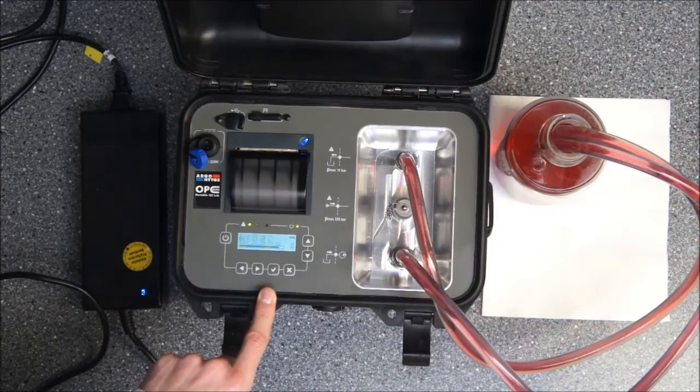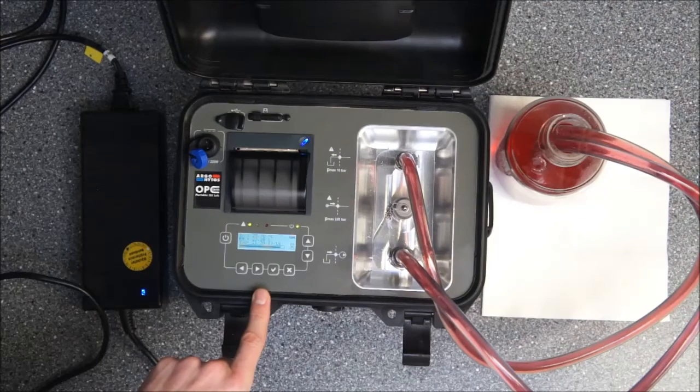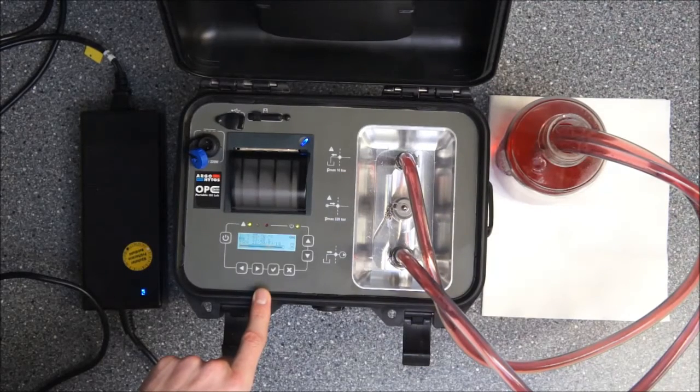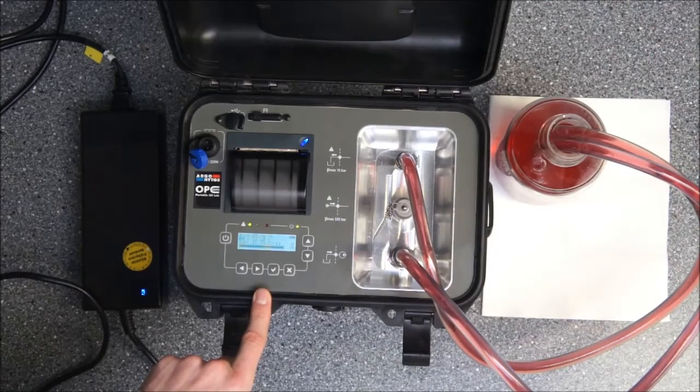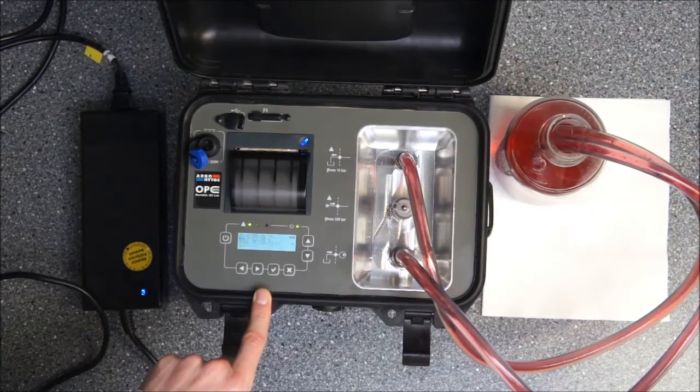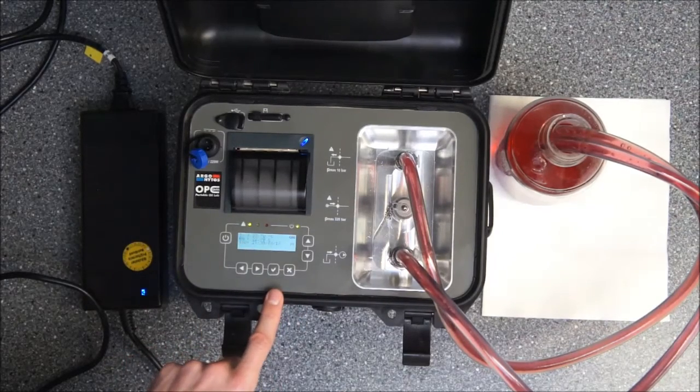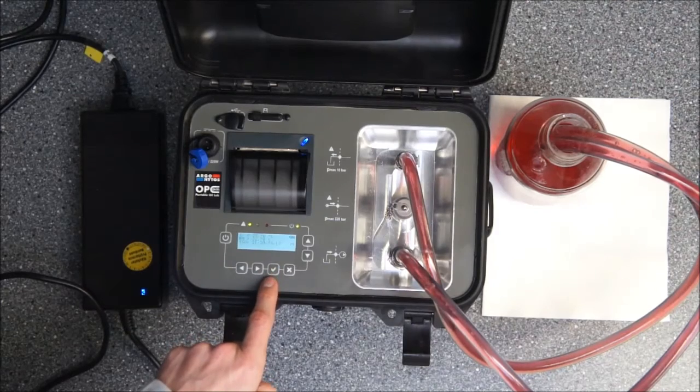When we have finished the next pump measurement I will also show you how you can activate the automatic mode. Now you see second reading has finished. We want to activate the automatic mode.